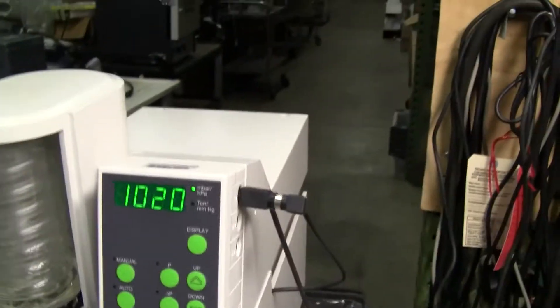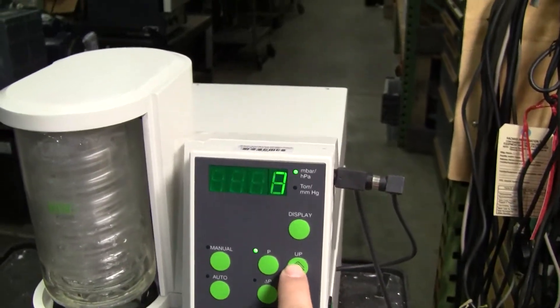I'm going to stop the pump there. I'll turn it on manual and set the pressure, set it at 100.